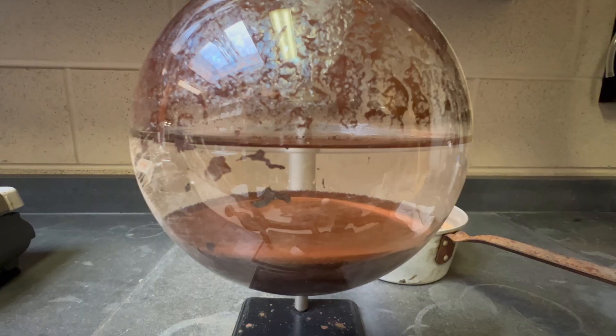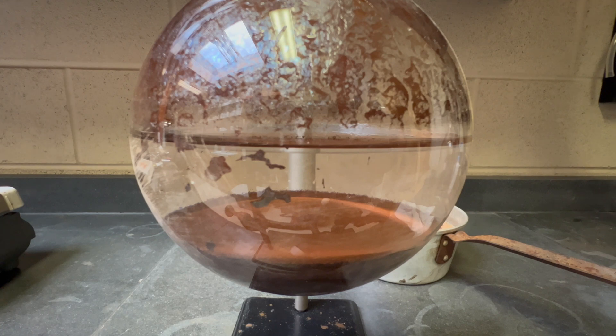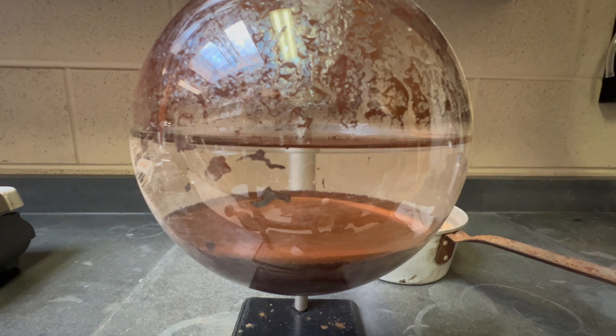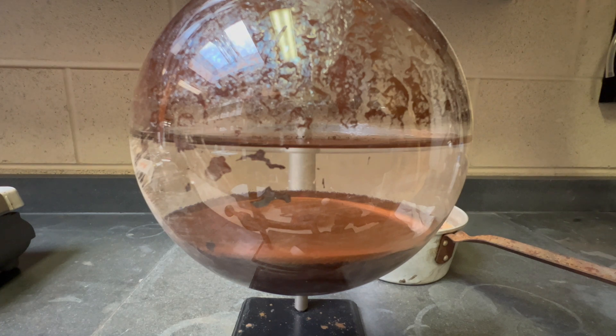After a few hours of reflux, turn off the heat and let the solution cool till the boiling stops. Next, wait until it's cool enough to hold the vessel.